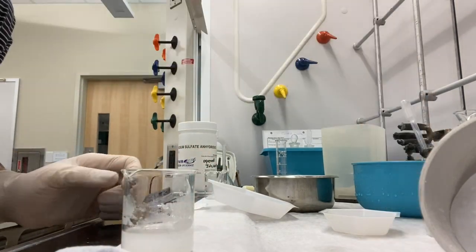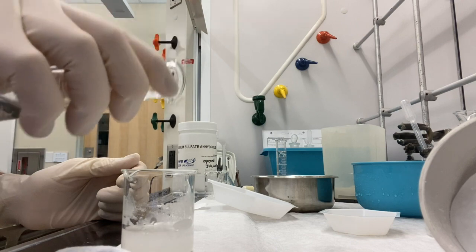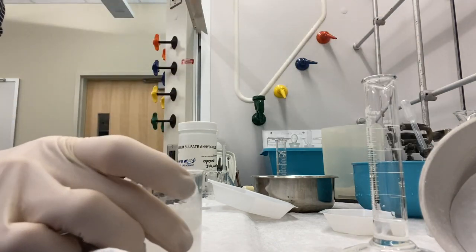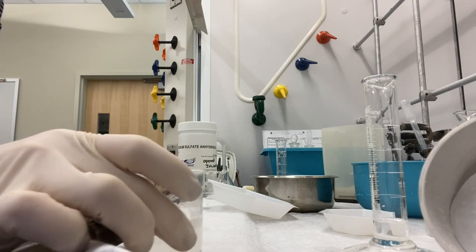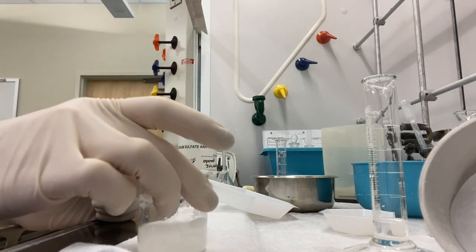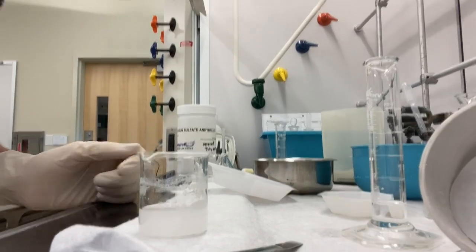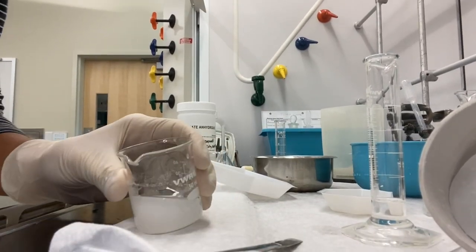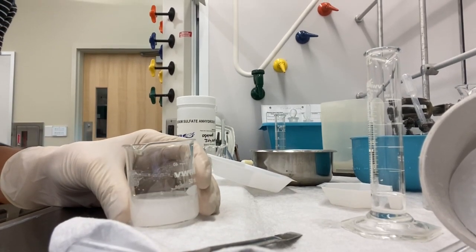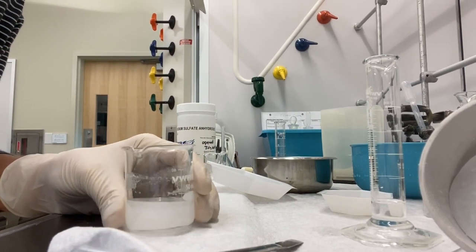It's a little bit cloudy, which means maybe it's really saturated. Or it could mean something else. So let me just add a little more to dissolve some of that solid. And you can see that it's still cloudy. So it's probably no longer an issue of saturation, but probably an issue of having some residual water left over in that solid.